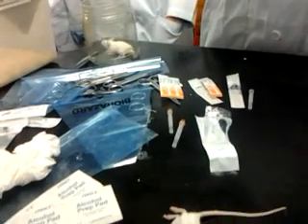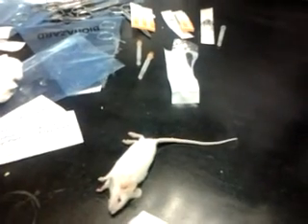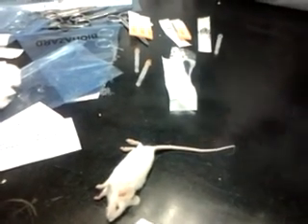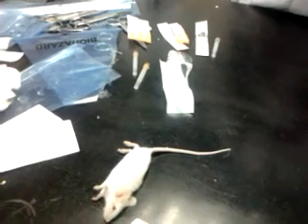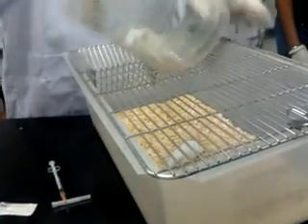For intramuscular, I shouldn't use 0.1. I have to use 0.03. That means based on the body mass, it's about 25, 27, doesn't matter, we use it. Use the base here. Put them down.